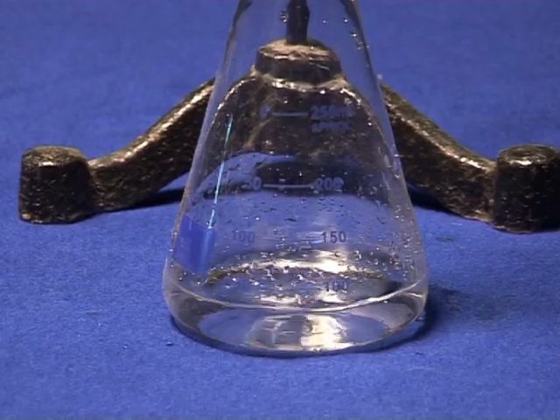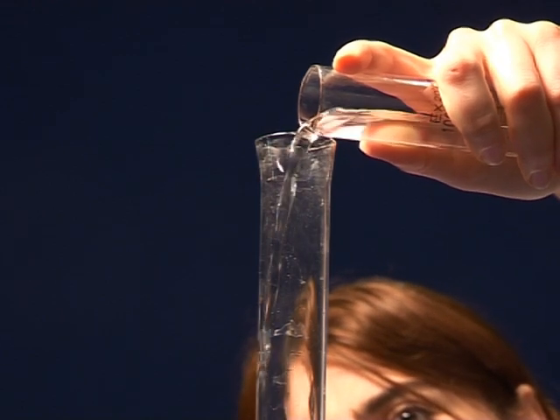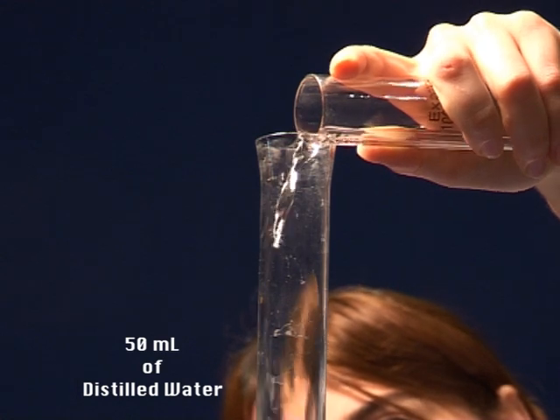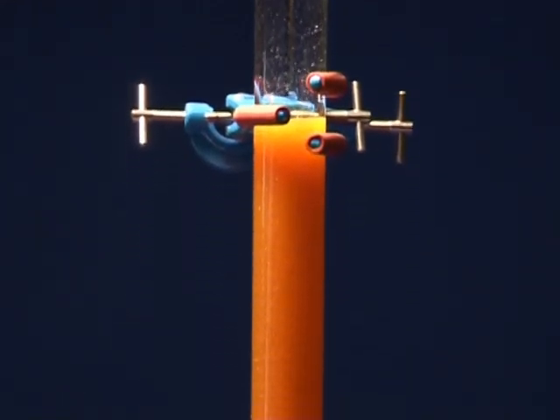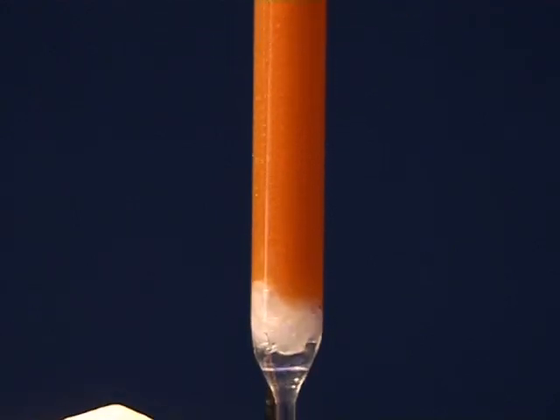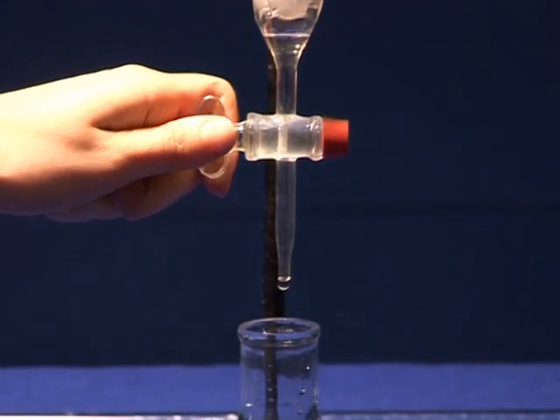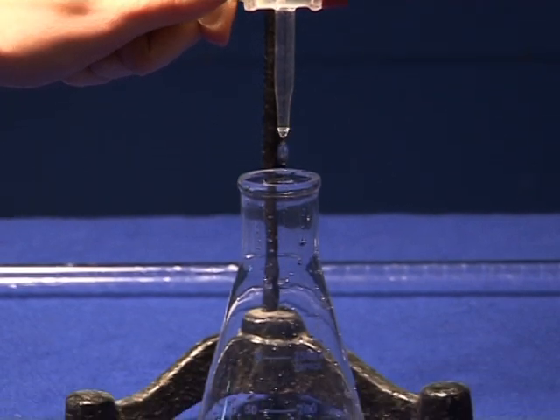When nearly all of the tap water has flown into the column, add 50 milliliters of distilled water to the column. Loosen the clamp and allow distilled water to pass through the column.